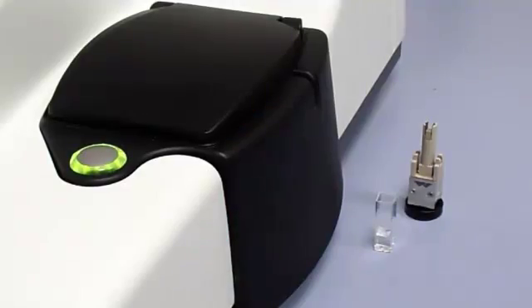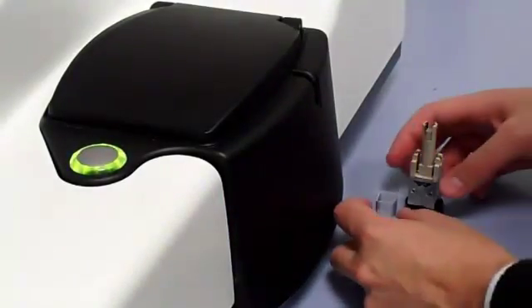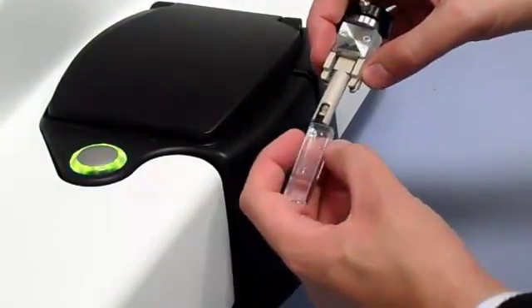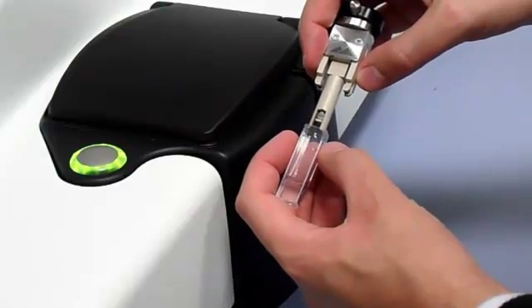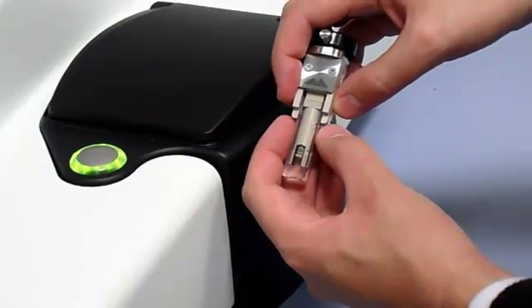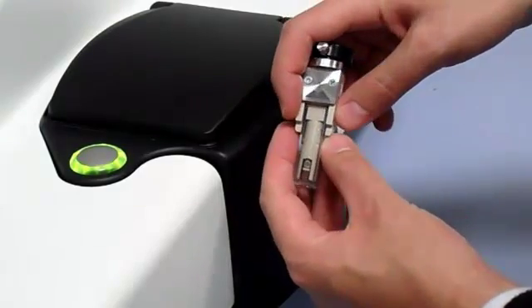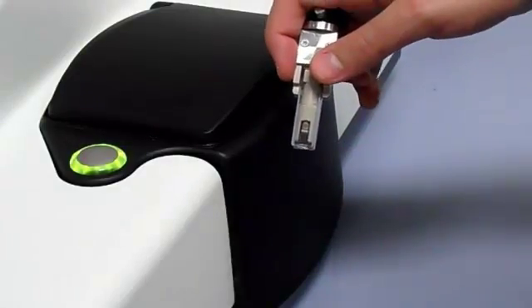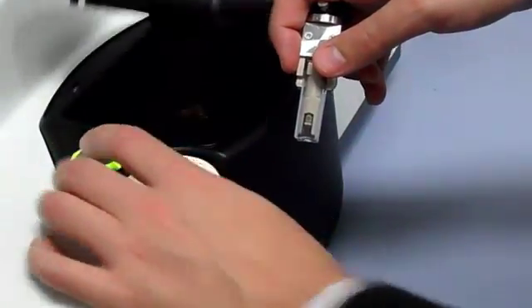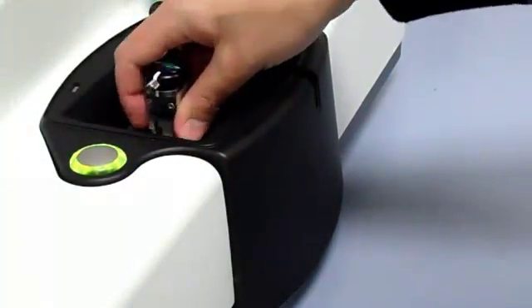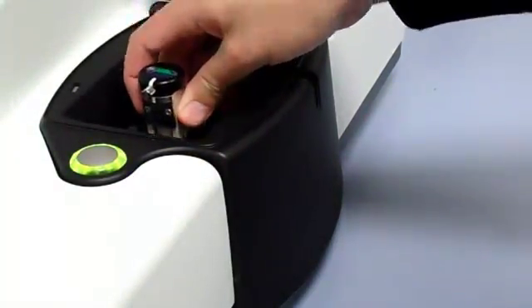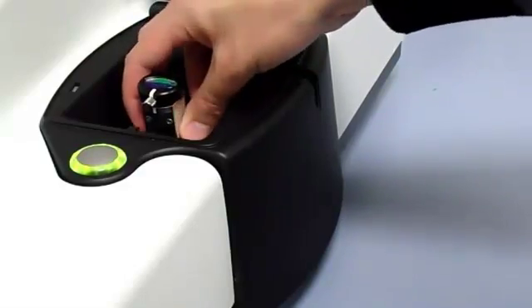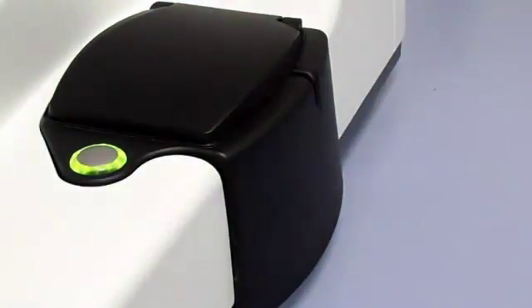Following coarse alignment, the cell is placed in the cuvette containing the medium to be studied and the tracer particles. Ensure that there is enough fluid in the cuvette so that when the cell is inserted, the liquid level is well above the sample and the screw that holds the sample holder in place. Place the cell and the cuvette into the zetasizer with the curved front of the cell facing the front of the instrument.